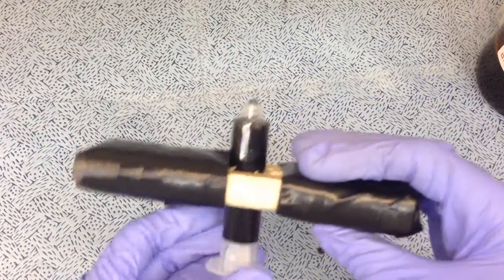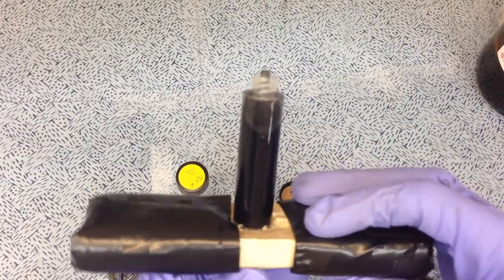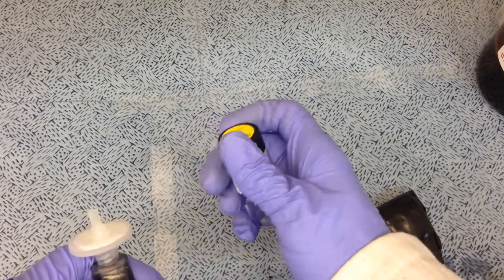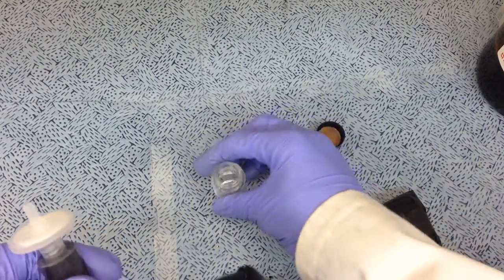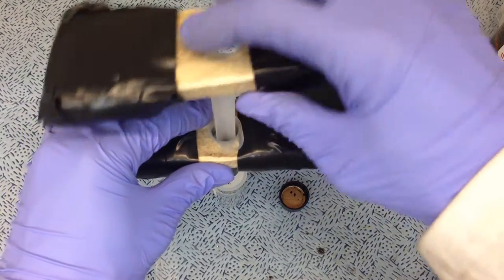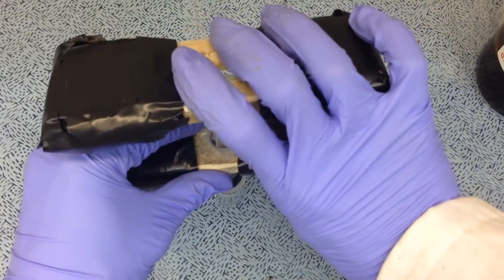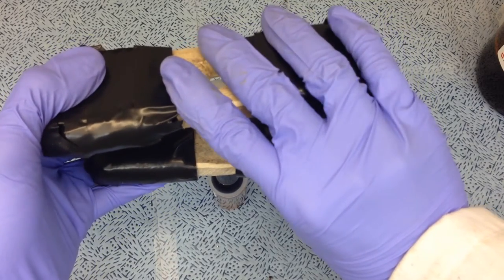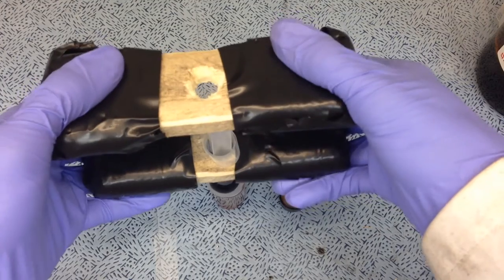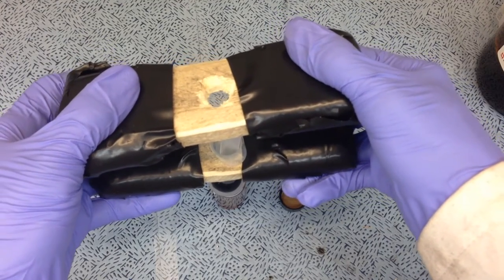Just put it on. And then the second piece, I will use the top. Here, I'll put my filter on now. And now for my collection bottle. Put it in like this, and I get a job that would have been quite difficult. Makes it a lot easier because I can use the full strength of both my hands rather than that.